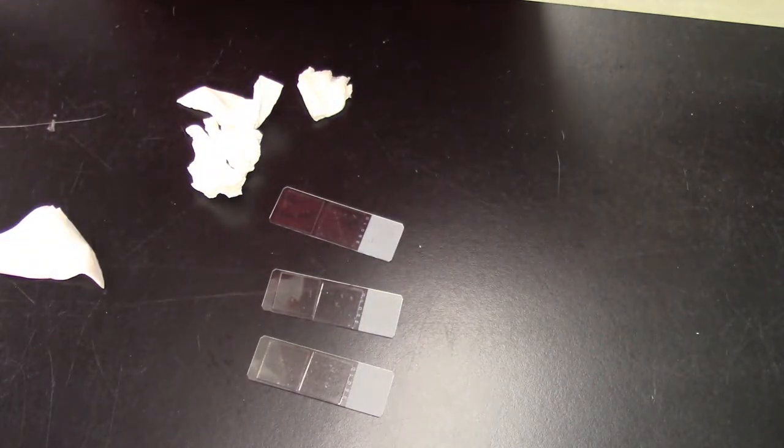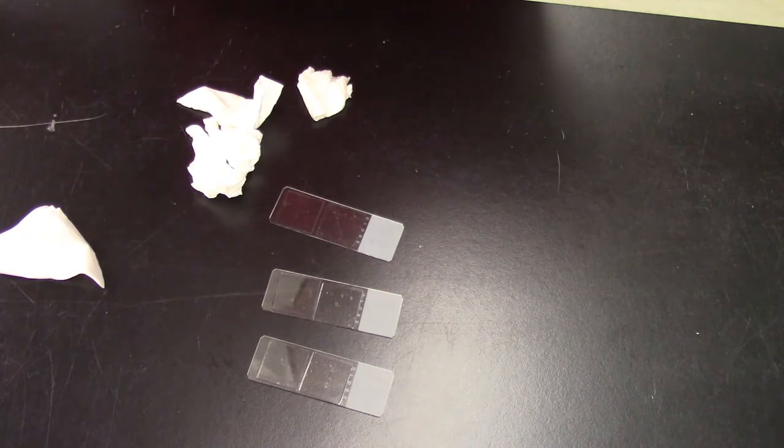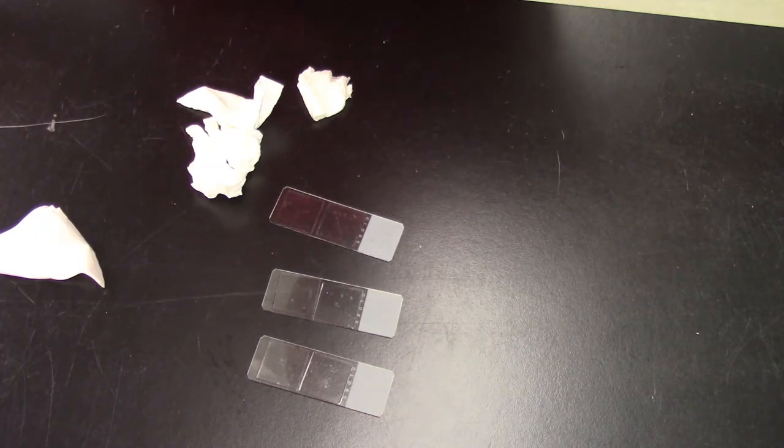Well once you finish the imaging, you actually have to remove the drop of oil. Otherwise the oil is going to harden on top of your sample and that coverslip is now garbage. So how do you clean it? The same exact way.